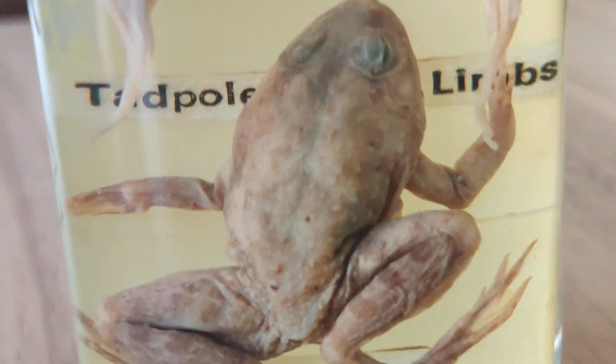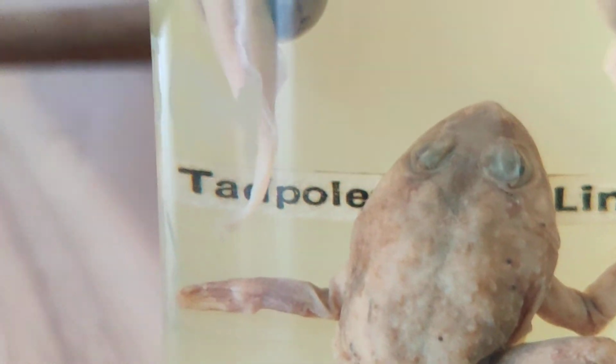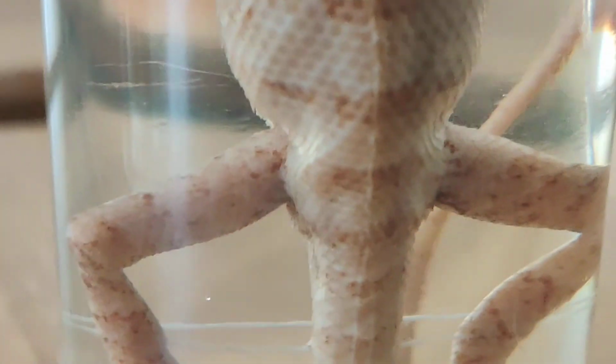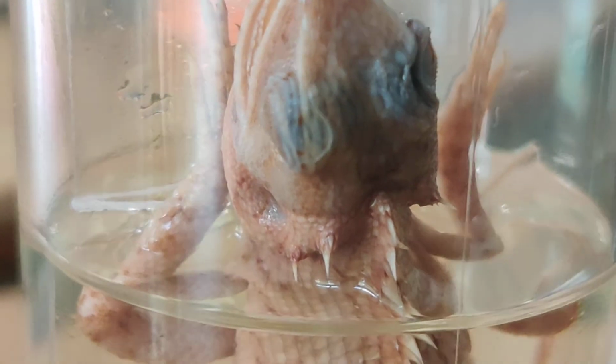Now amphibians. In amphibians, this is frog. You can also see its life cycle. Frogs actually develop from tadpoles. These are the larval stages of frog, tadpole and tadpole initial stage, and you can also see the eggs. And in reptiles, it is garden lizard. You can see it has scales on the body, and a long tail, its organ of support. You can see its eyes located on the top.